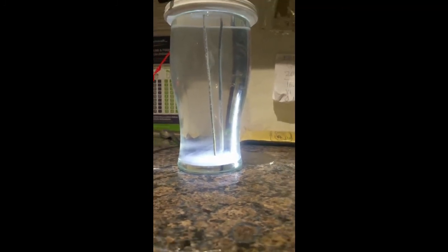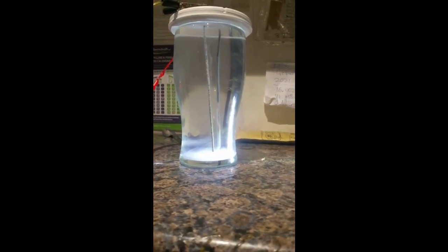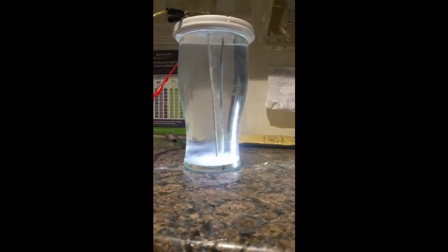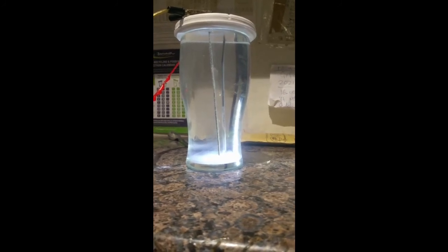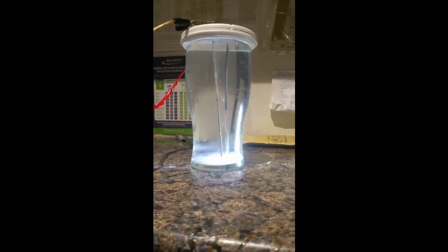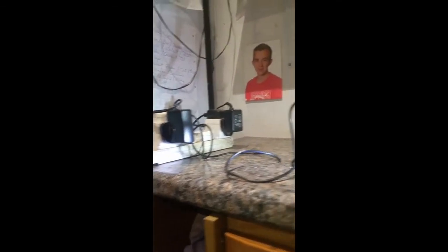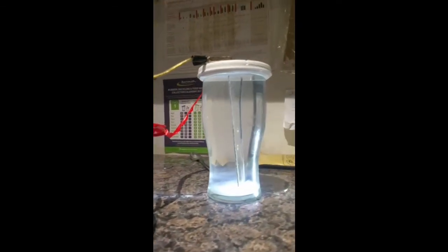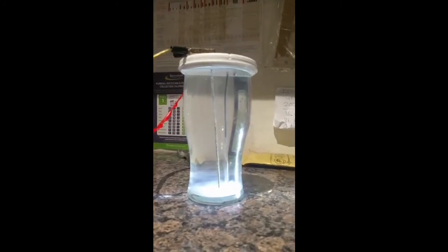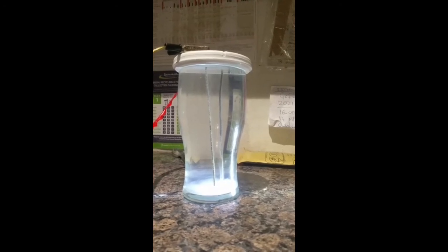When I put it on the heat of about 60 degrees with two drops of reducing agent, as you can see in my other video, it turns a lovely golden color. So this at the moment is the best way that I have found so far to make colloidal silver, using a 12 volt 500 milliamp charger with 10 small spatulas of bicarb to one pint of distilled water.